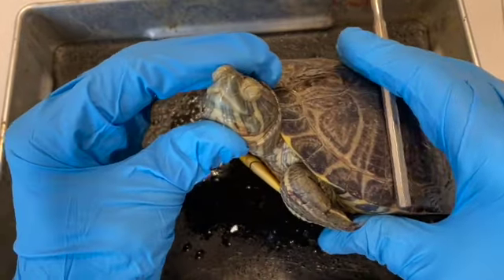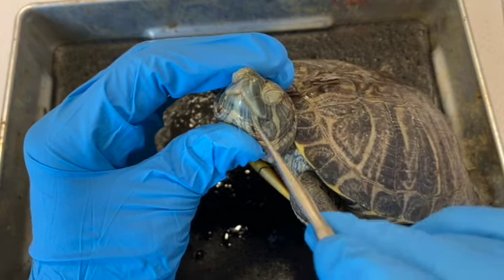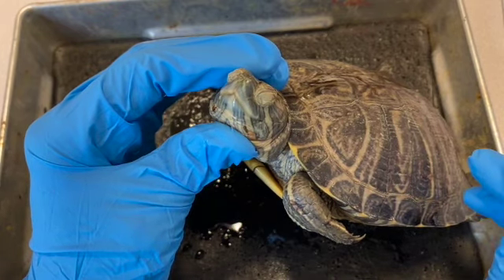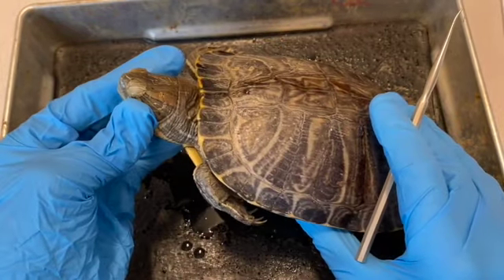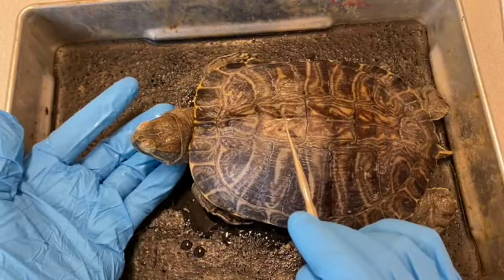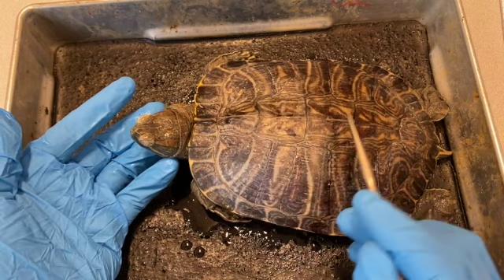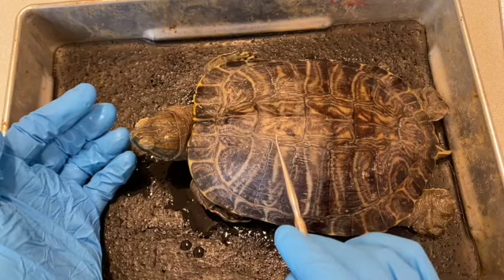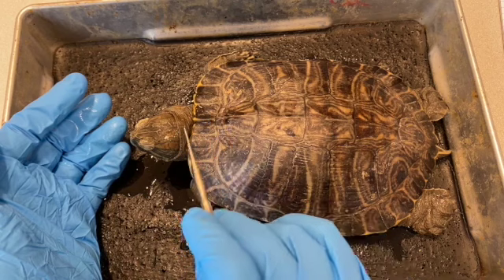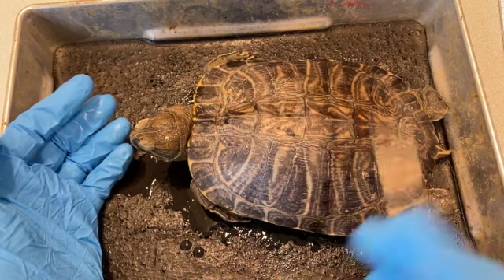They don't have teeth. They have rather this bony beak-like structure that they use to tear off their food so they can swallow it. The neck is long and flexible. In the specimen that we have here, the muscles are largely contracted. Now the head is not completely contracted, but in most of our turtles, the bones of the neck, there are many of them, and they will bend into a dorsal ventral S shape that allows the animal to retract its head inside.